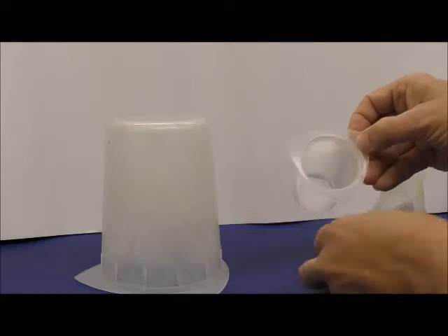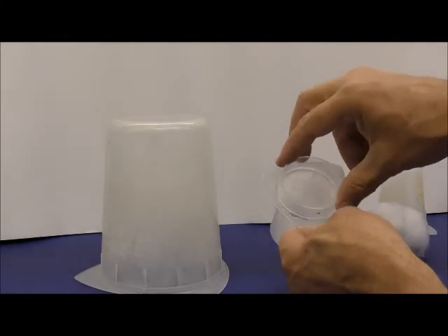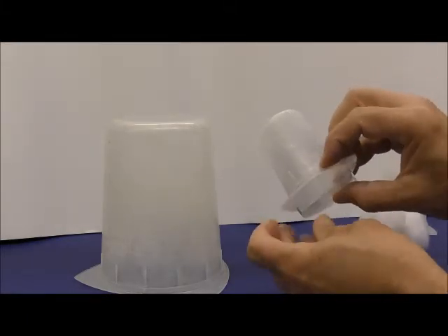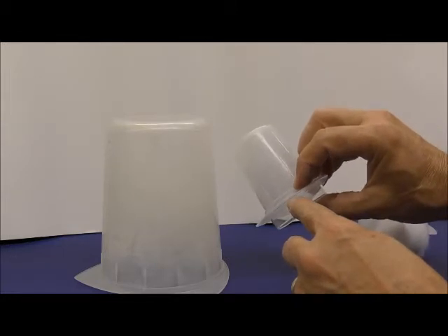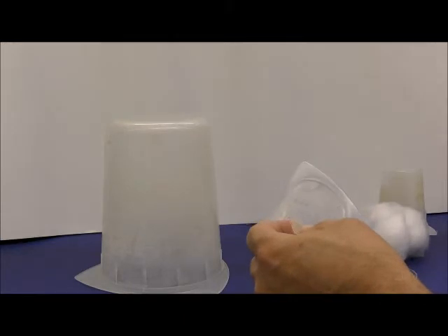This is the lid of a petri dish. If you happen to use the bottom part of this particular petri dish, it looks like it's going to fit in, but then there's a tiny gap right here. The flies will come out, so you have to be careful about which petri dishes you use.